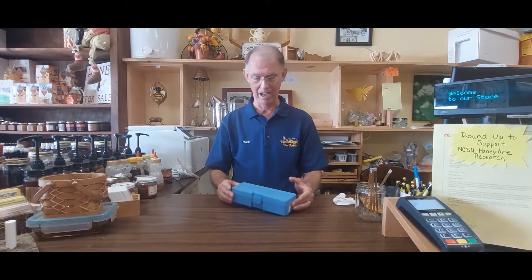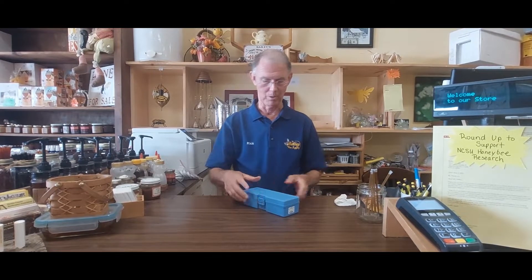Hi, I'm Rick. I'm at Bailey Bee Supply today and I want to show you how to calibrate a refractometer. So I have one here. I'm going to go through unboxing it so you can see what we have in it.